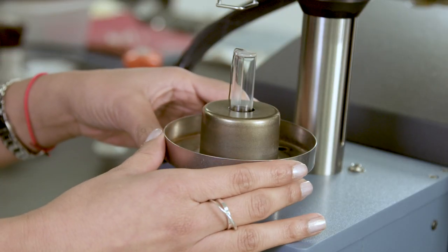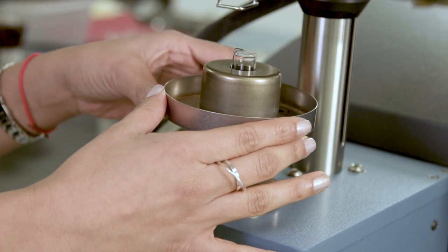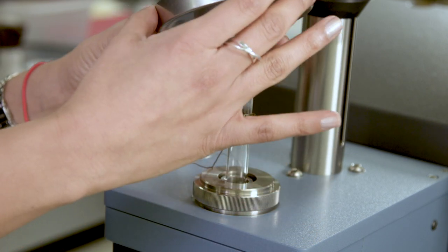To remove the stage, first remove the drain cup from the base of the stage by lifting it straight up.